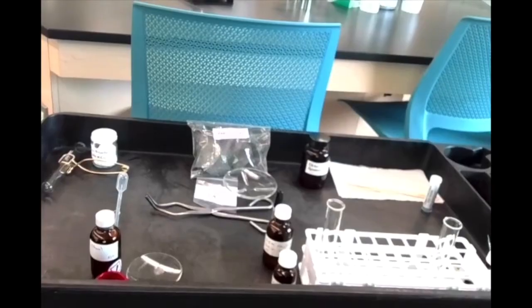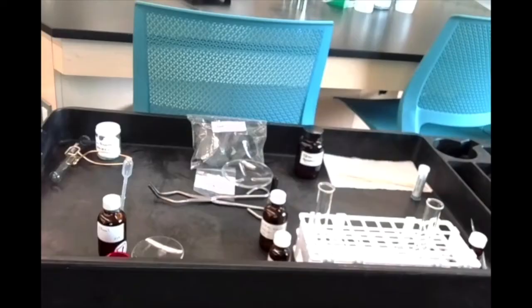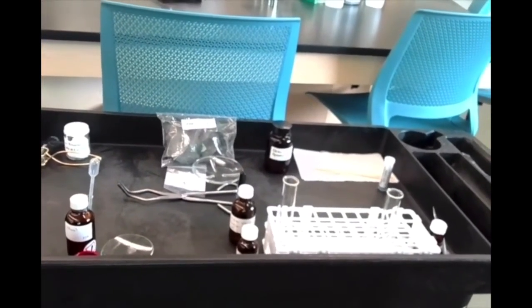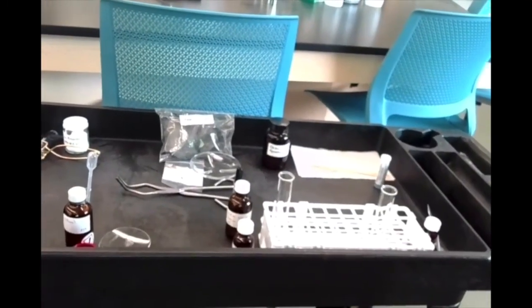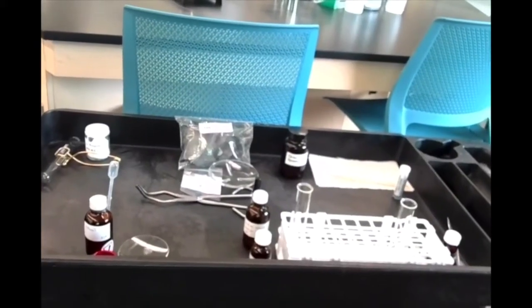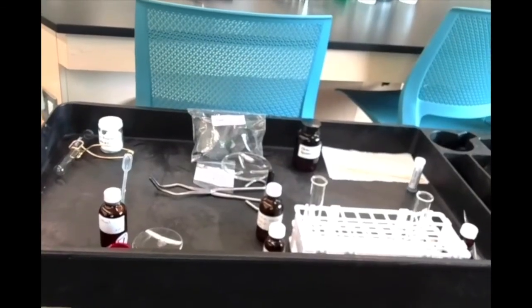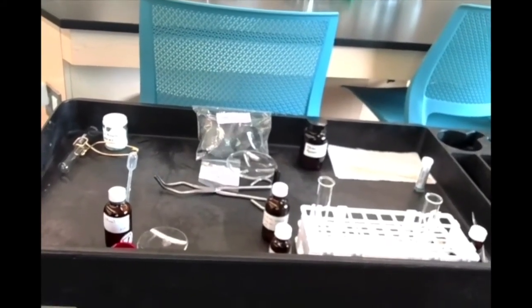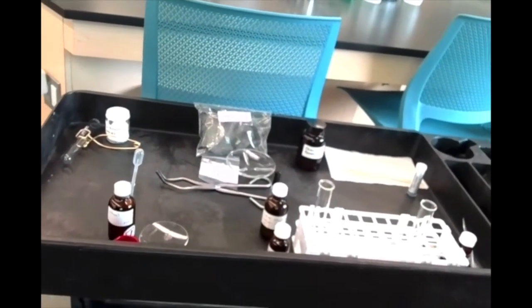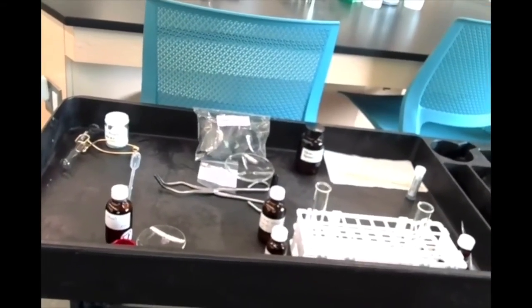In this lab, we're going to observe different chemical reactions and, first of all, identify that chemical reactions are taking place and look for signs of chemical reactions. We're then going to find ways to describe the chemical reactions. We're going to write out equations and balance them, and we are also going to classify the reactions as one of 5 types: either synthesis, decomposition, combustion, single replacement, or double replacement.